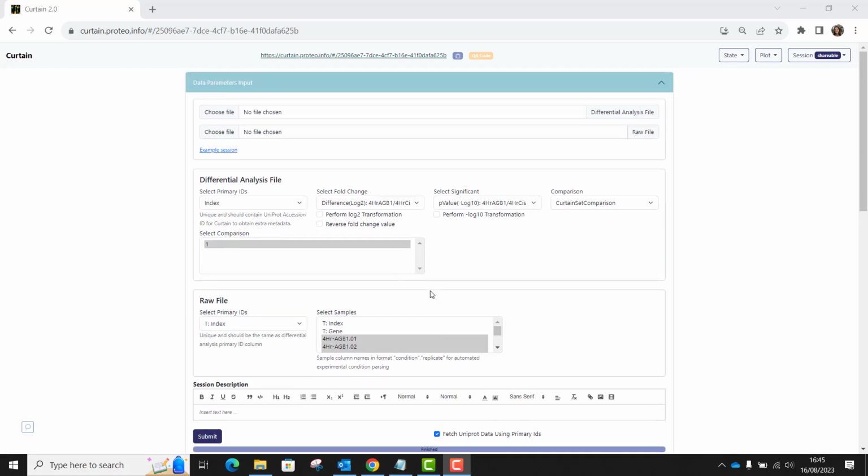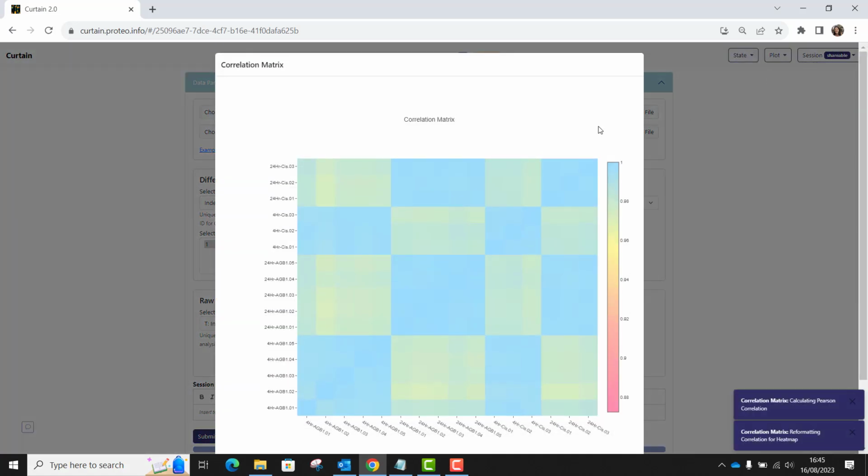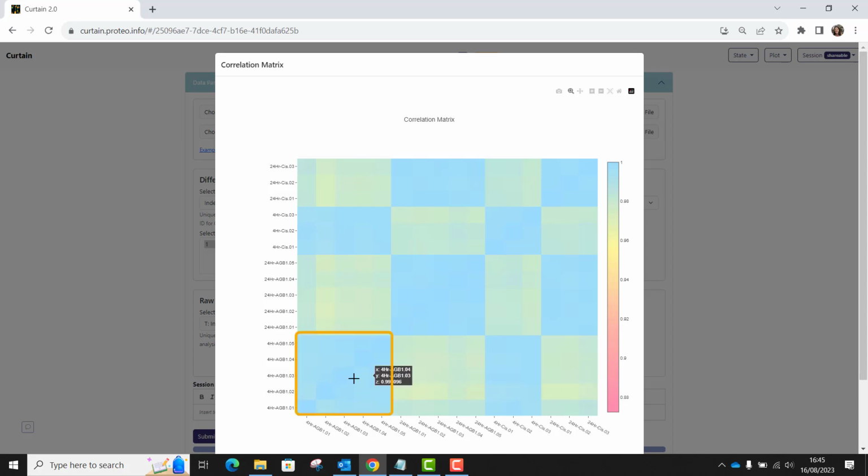One thing you can do to assess the quality of your data is to go to Plot in the top right hand corner and Correlation Matrix. This will show you a Pearson correlation matrix of your data. Where the matrix is blue, that indicates a very good correlation between samples, going down to yellow and then red with decreasing correlation. We can see that the 4-hour AGB1 treated samples correlate very well together, and this part of the matrix is very blue, but the 4-hour against the 24-hour samples are more yellow, indicating a close but not as close correlation, which is what we'd expect.